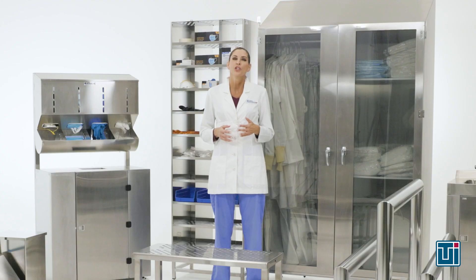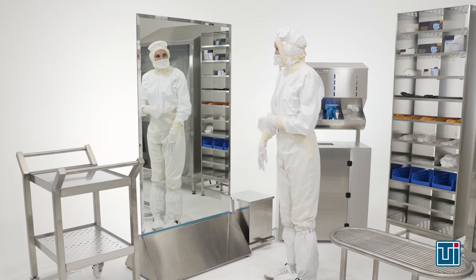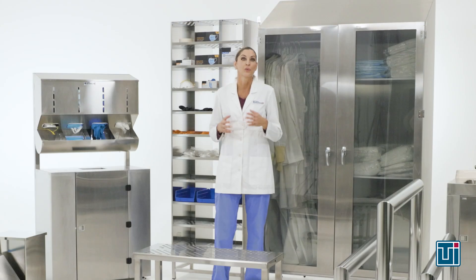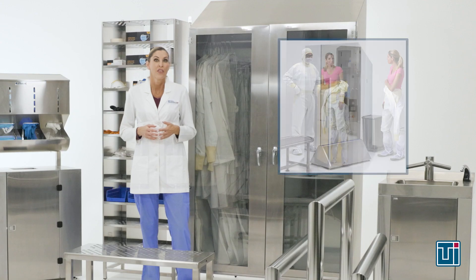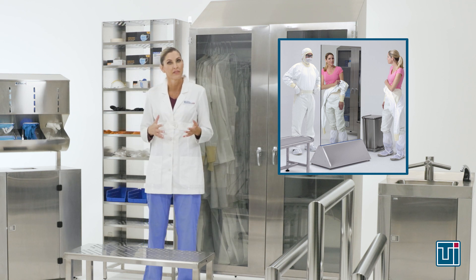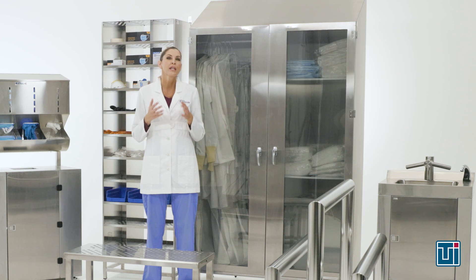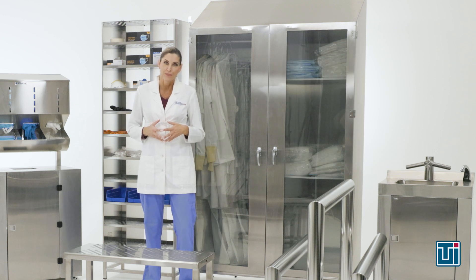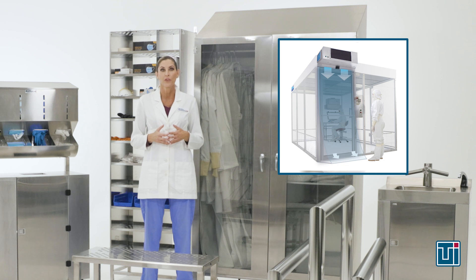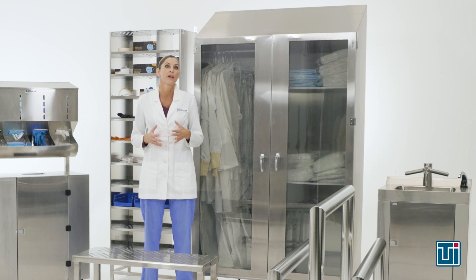Benches should be cleaned with a sterile wipe after every use. Before you enter the clean room, do a final visual self-check to ensure you haven't missed anything. Terra's dual-sided mirror uses frameless construction and an electro-polished stainless steel base for easy cleaning and positioning. The double-plate glass allows personnel to perform self-checks on either side of the mirror. After completing these steps, you are now ready to enter the clean room. Facilities maintaining ISO 5 and cleaner conditions commonly install an air shower or filtered air curtain to remove any loose particles from personnel immediately prior to entering the clean room.